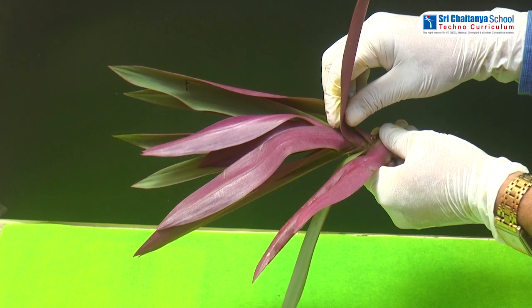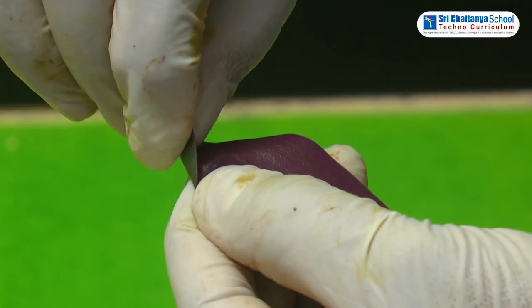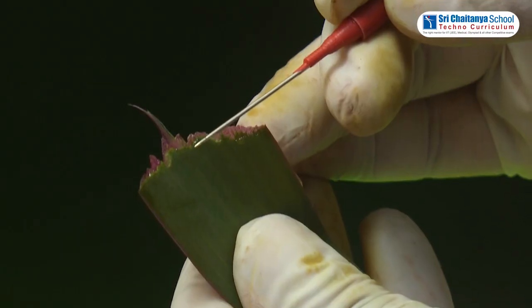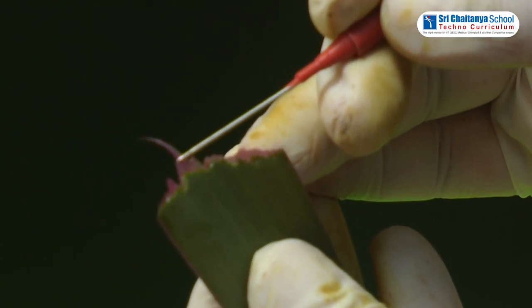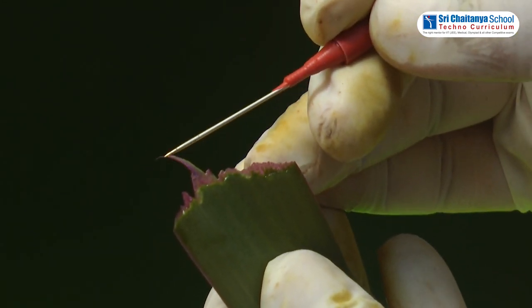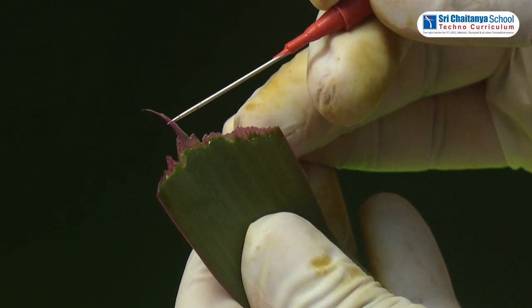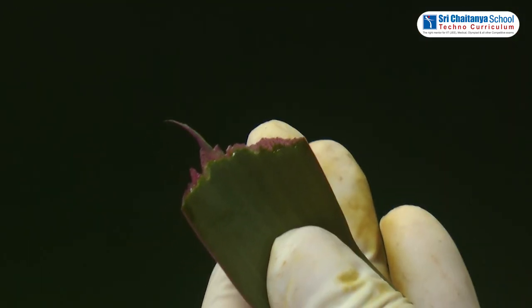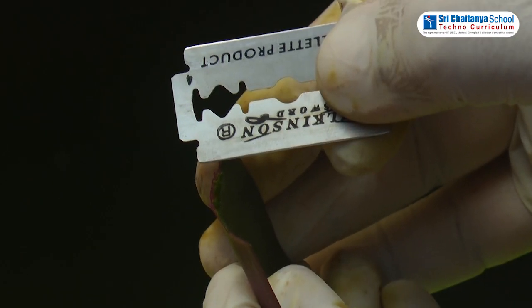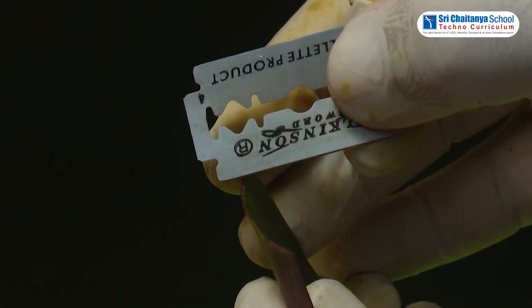To do this experiment, first cut the leaf from the plant. Tear it in a single stroke, and you will see a very thin layer of the lower epidermis. Cut the thin lower epidermal layer with the help of a sharp blade.